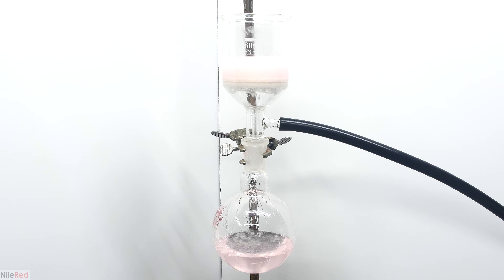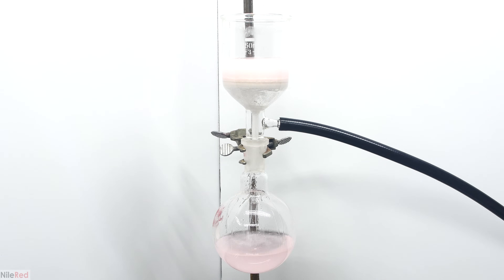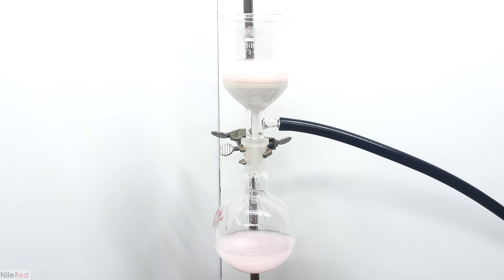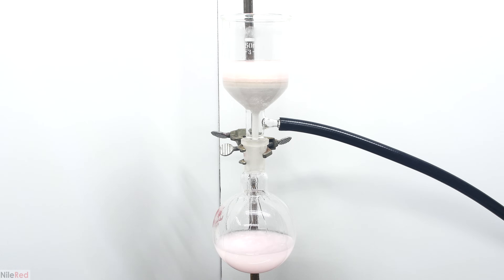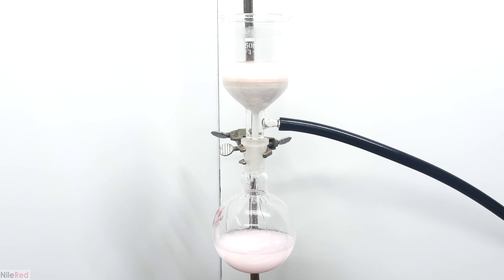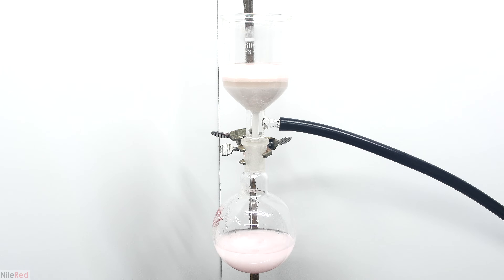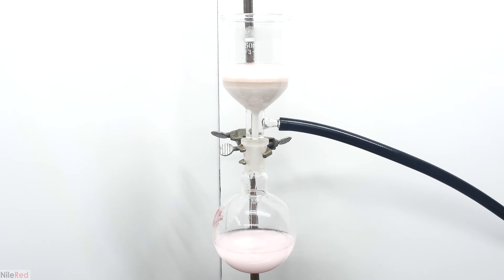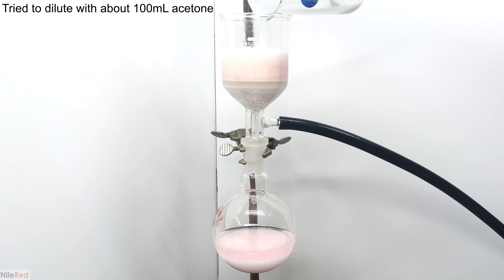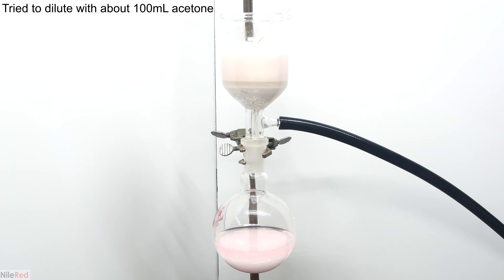You can actually see the moment here where the problem occurred. Everything seems to be going more or less okay, but very quickly a lot of ASA starts to crystallize out. In the flask below this isn't much of a problem, but an issue arises at the filter funnel — the narrow stem gets pretty much completely blocked and filtration comes to a stop. I tried fixing things by removing the blockage and diluting with some fresh acetone, but it didn't really seem to work.